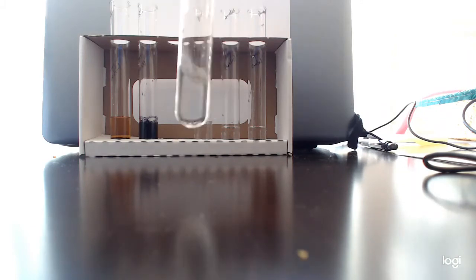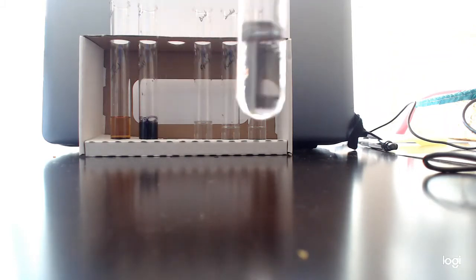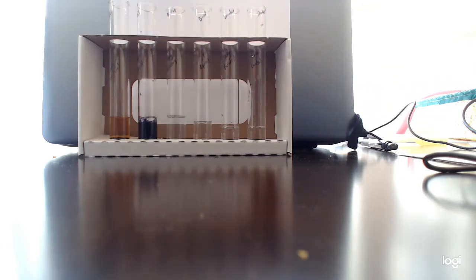Okay, that's roughly 20 drops, and you can see that there has been no color change. If anything, it's kind of clear, maybe at most a light blue. And of course, we expect that. There should be no color change for this colorimetric qualitative test if, in fact, there are no proteins in water, which hopefully there aren't. Now, I'm going to go ahead and put protein positive control into the other tube.